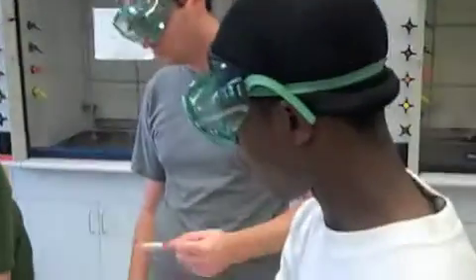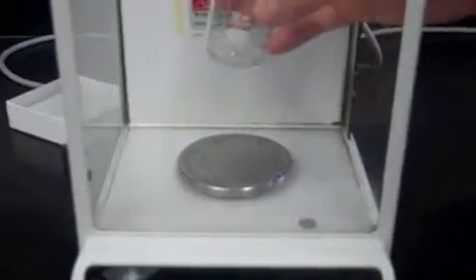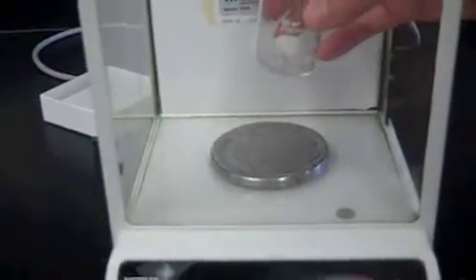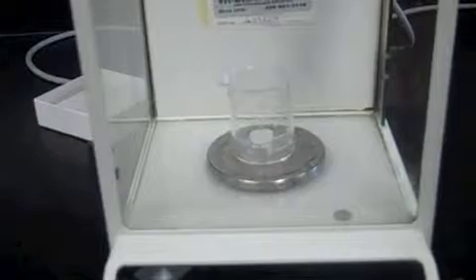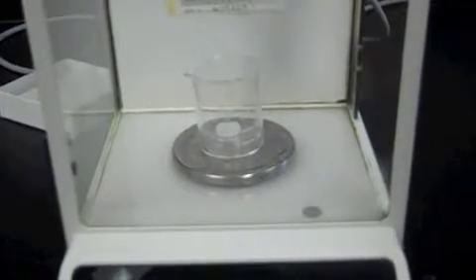Now we're releasing the measurement into the beaker to be weighed. Oh, and then I'm going down to taring the balance. I'm going to reweigh this beaker to get an accurate measurement when it gets down to 0. If it gets down to 0. Try it one more time. Okay. So David, we're going to record this as 27.712 grams. 712. Yep.